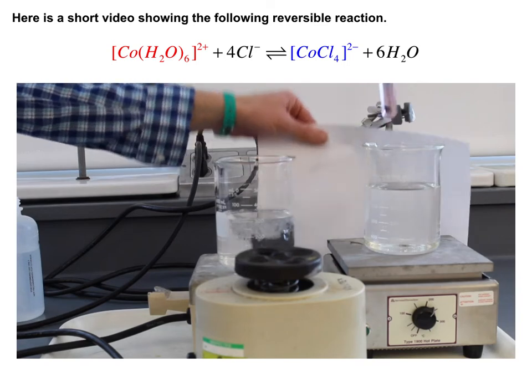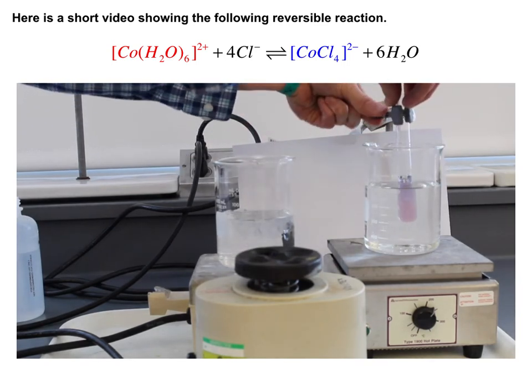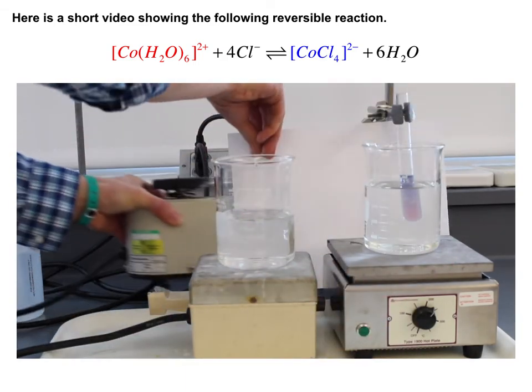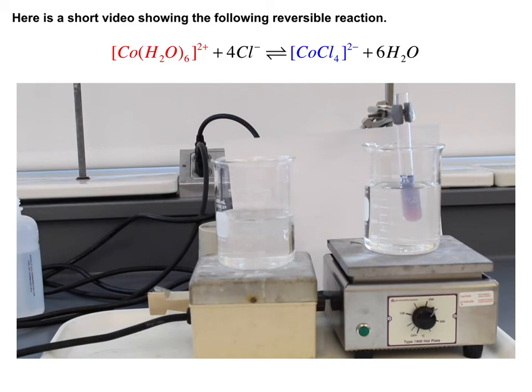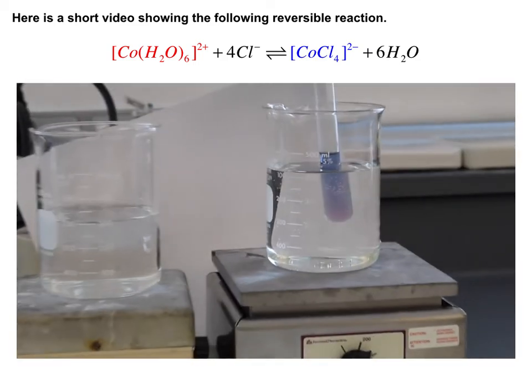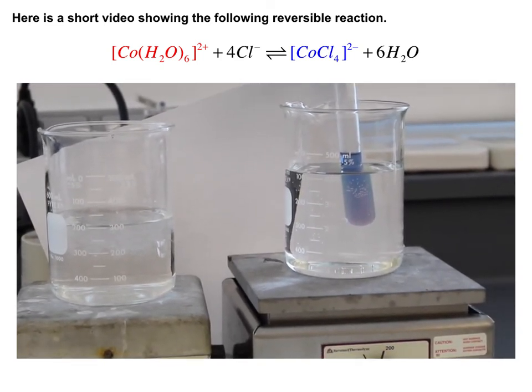So we'll go ahead and watch. So here we go. Here's our pink colored, so we're mostly on the reactant side. We put this into warm water, and then we can sit back and watch and say, what is happening to the color of our solution? This is my camera work, and so what's going on?